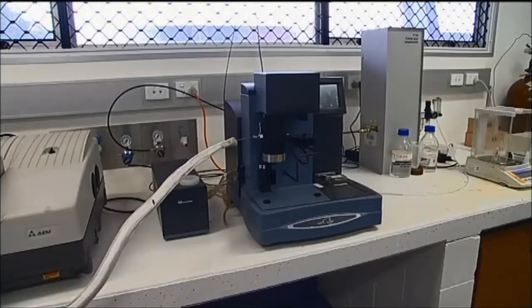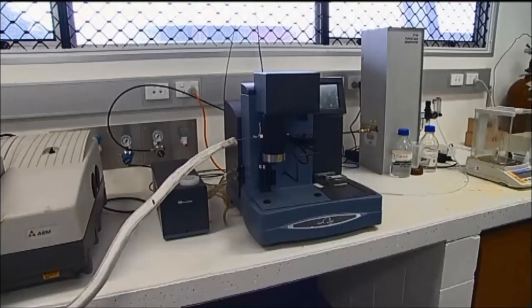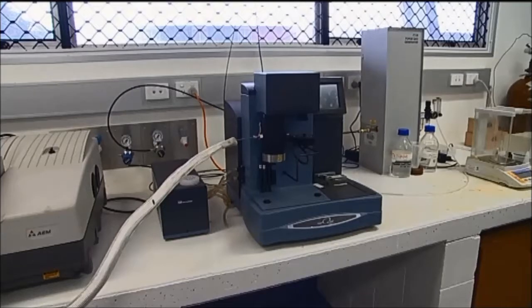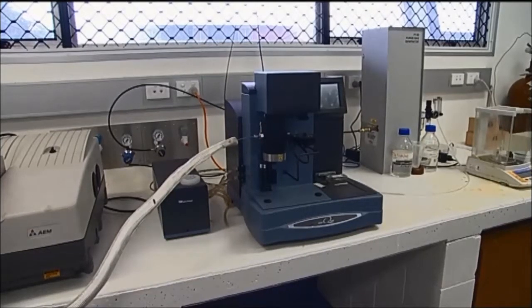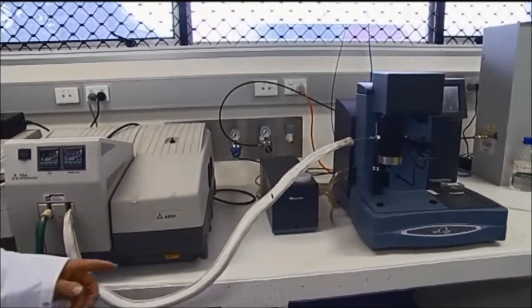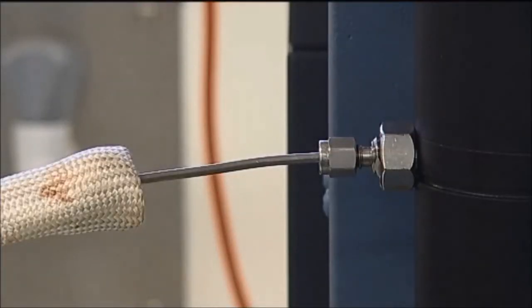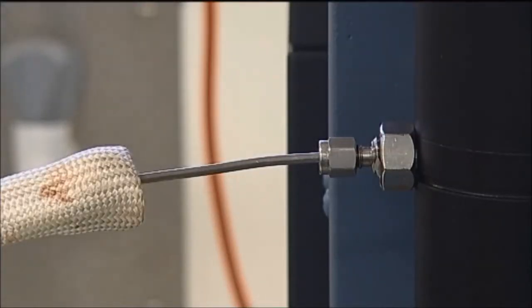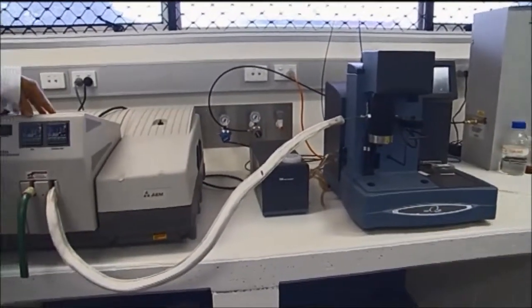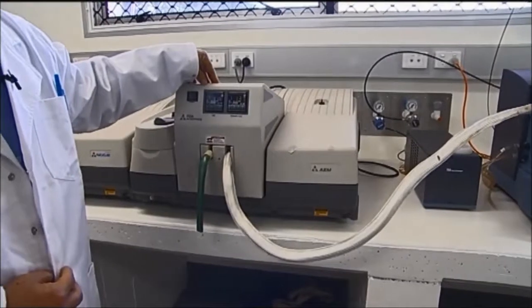The TGA can be coupled with the IR spectrophotometer to identify the chemical composition of gases emitted. Here we have the TGA-FTIR simultaneous system, where the gases emitted during combustion inside of the TGA furnace are collected and sent into the gas unit of the FTIR spectrophotometer.